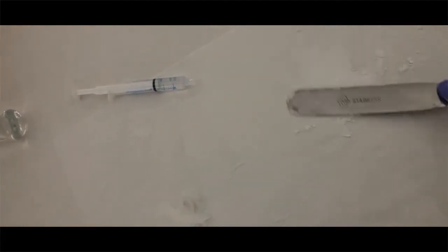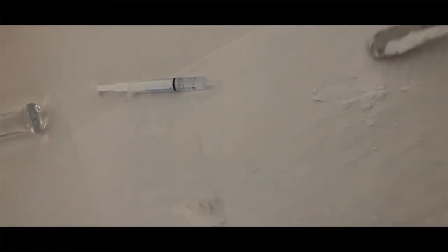So as I go back and forth, I'm going to continuously adding small amounts of that mineral oil until I get a uniform paste consistency out of that. Once that is done, now I know that I'm not going to get any dry chunks in the ointment when it's finished.